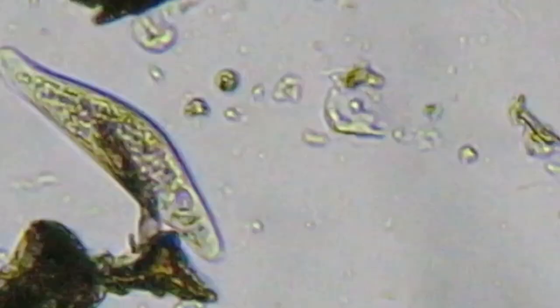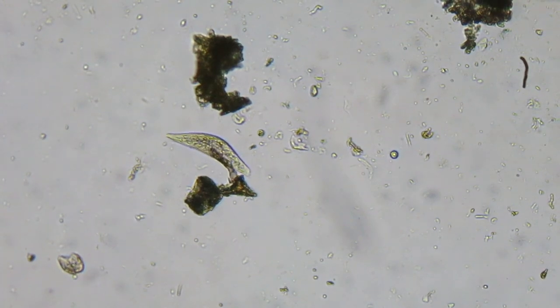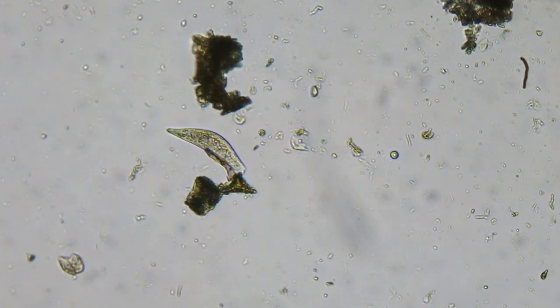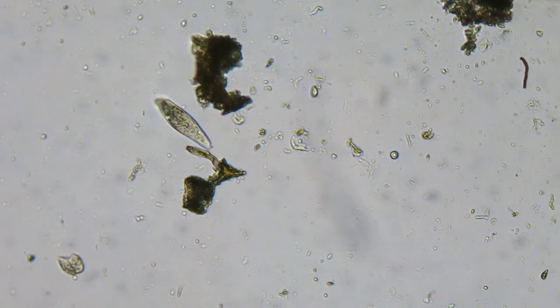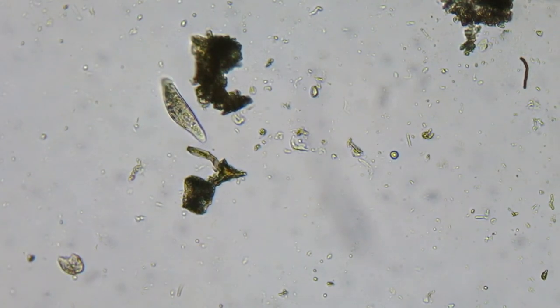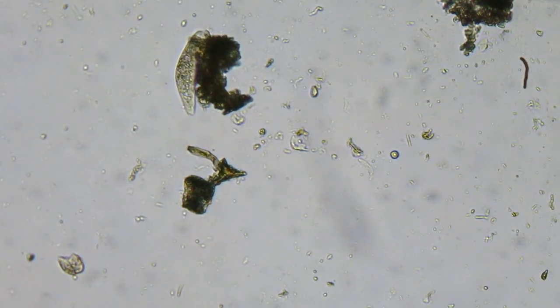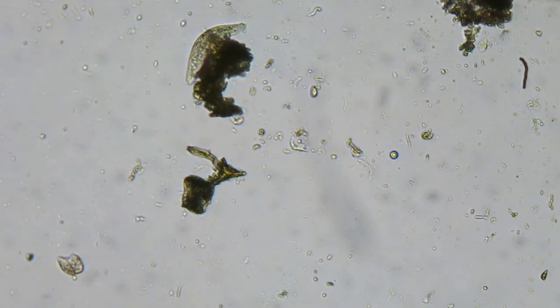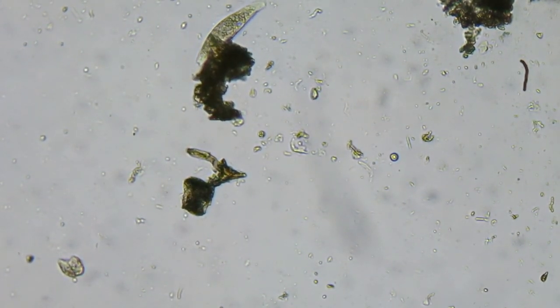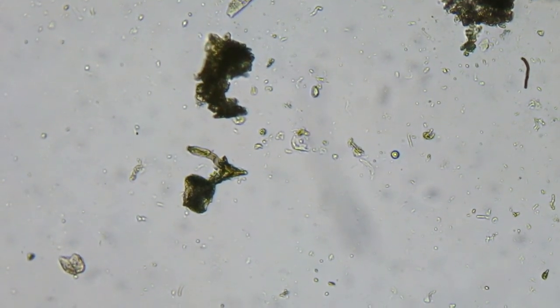You can see really well there the cilia. Because the water is so deep he can go in and out of focus very easily. They also use those cilia as a form of motion — you can see here he actually grabs onto that piece of debris and he's kind of going around it looking for food, and away he goes.